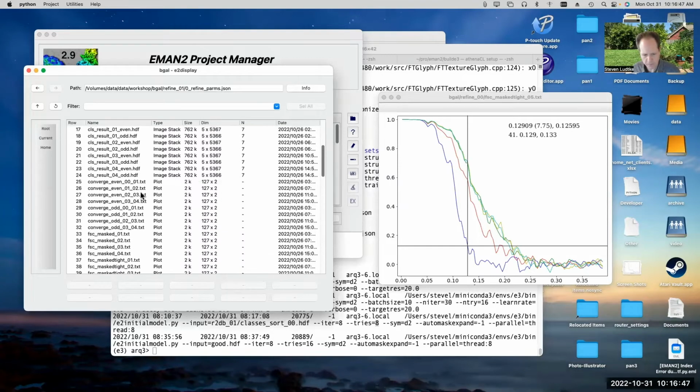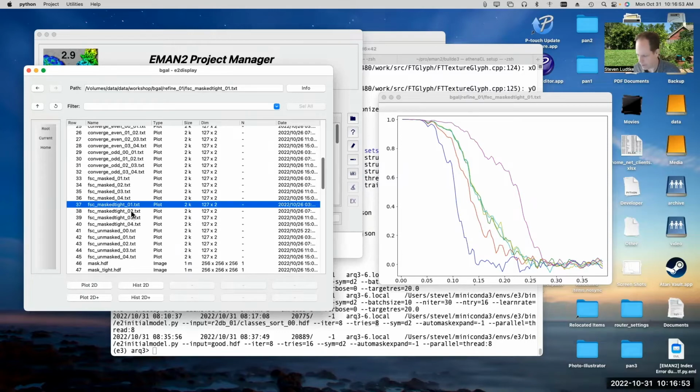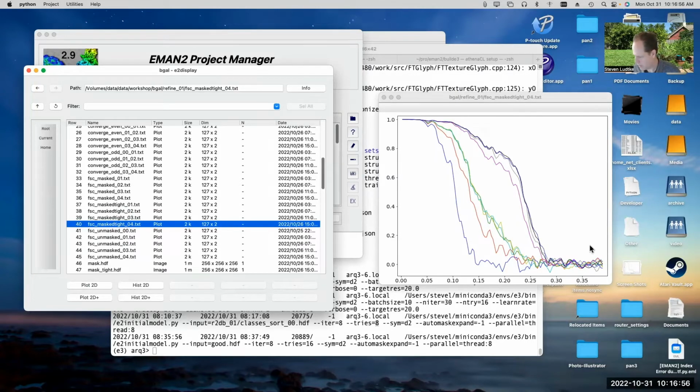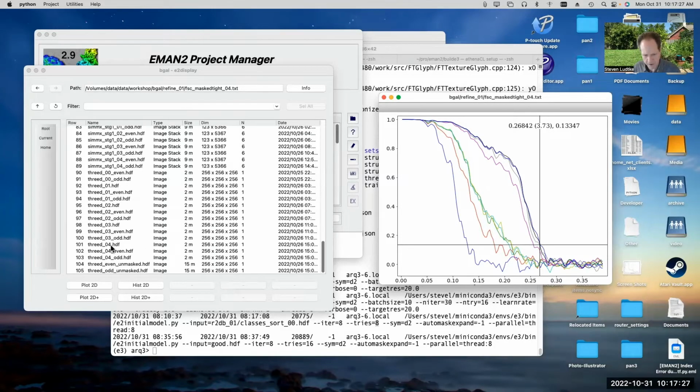All right, so let's look at the FSC curves from the second run, and we'll see. Oh, look, it started there. So ostensibly that got to about 3.7, 3.8 angstrom resolution. It probably would have been very slightly better if I had used top hat equals local, because it would have locally filtered out some of the noise and it wouldn't have contributed as much to the FSC curve. So local resolution can actually have an impact on your measured resolution, but not a profound impact, just a minor impact.